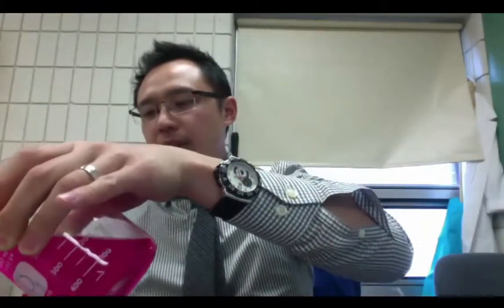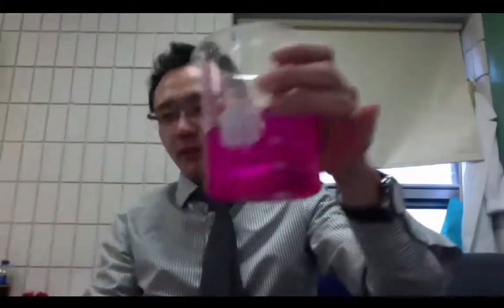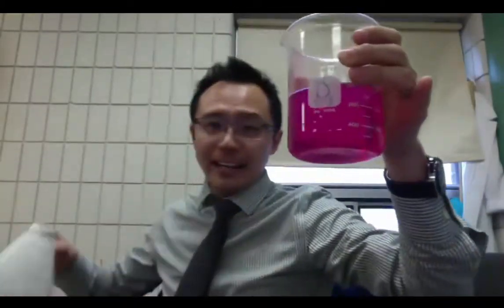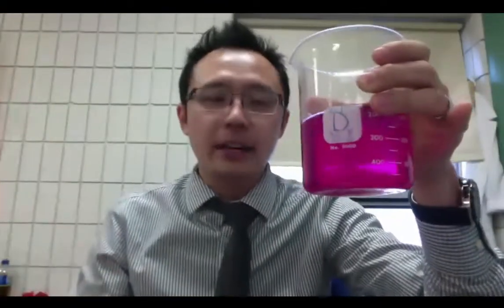You must be wondering, can I change this pink liquid back into colorless? I can. So right now this is very basic because phenolphthalein detects it has a color change when it's about pH of 8 and over. So 8, 9, 10, etc. So this is pink. So it has that high pH.